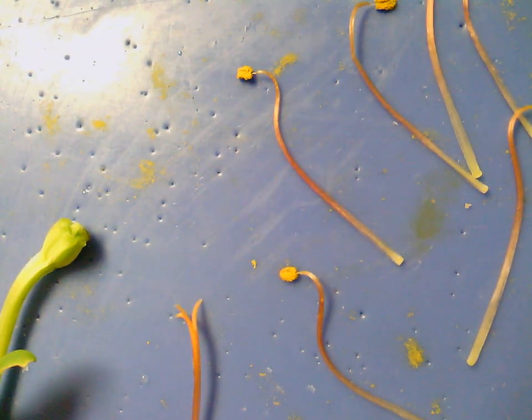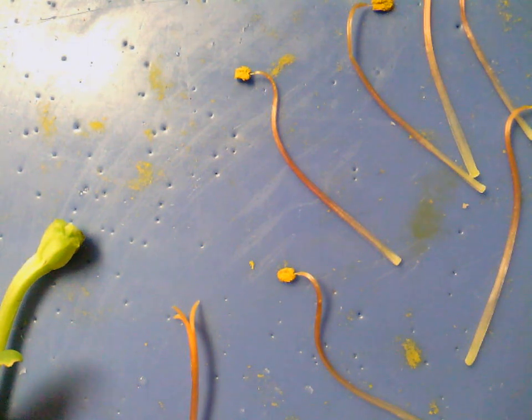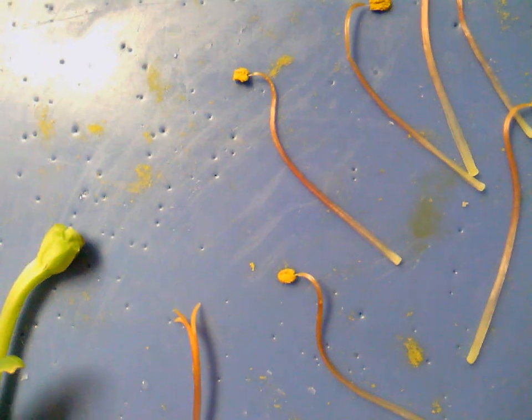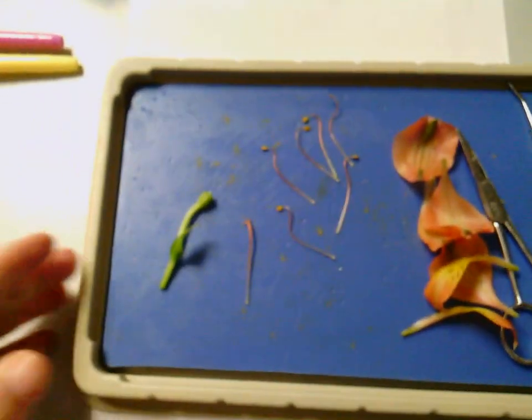Take a close look at that, and then on the microscope there's also another stamen. You won't be able to see it in color, but you might be able to see the shape of the pollen. So that's what you're looking for. You're trying to look at the pollen itself and look at how it is located on the stamen. So once you get that back into focus, we'll come back over here.